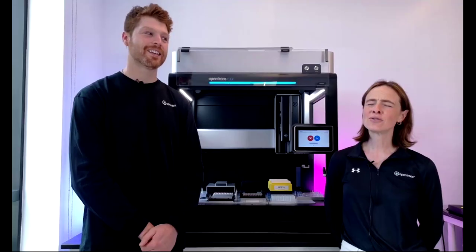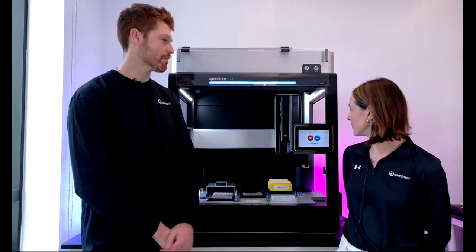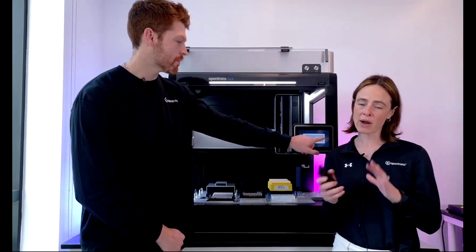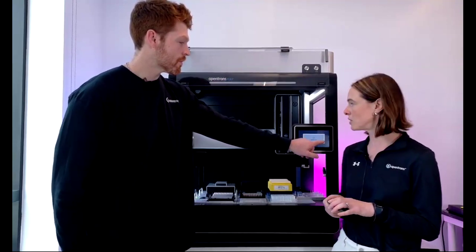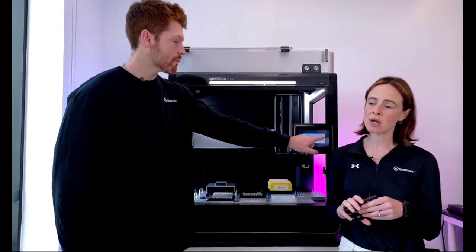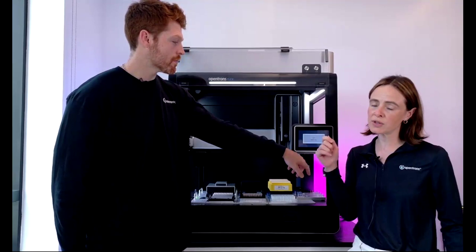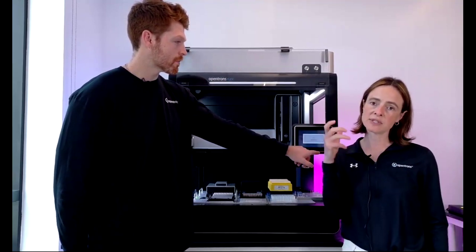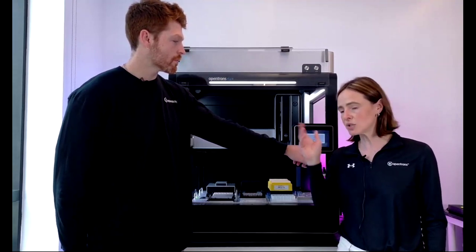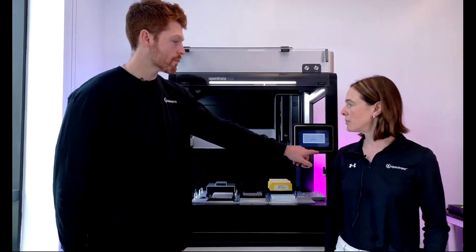Great. Ihab, does it require an FSE to install the 96-channel pipette head? What about the single and multi-channel? Oh, that is a great question. I love this question. So maybe if we move the gantry to the front, you can install and swap out and change the pipettes and the gripper yourself. Each pipette just has 2 small screws that you would need to remove, and we provide the tools to do that. Then the pipettes slot easily off, and exactly the same putting the new one on. It's just 2 small screws to screw them in. The same with the gripper.